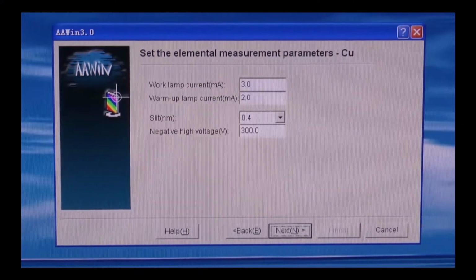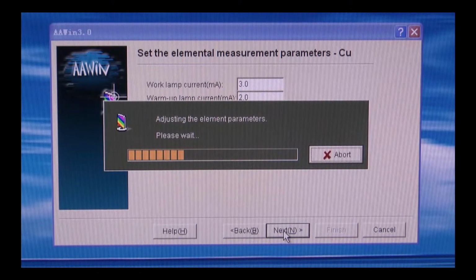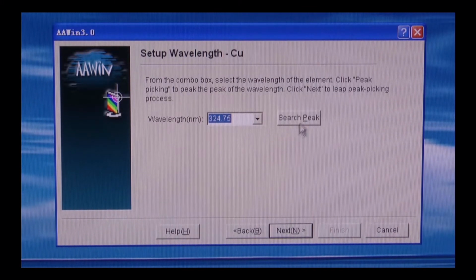This interface is to set parameters of the working lamp. For work lamp current and warm-up lamp current, we normally take the default value. Slit, most of the time we choose 0.4, but for different elements, you can take a reference from our cookbook. Negative high voltage, again, you can keep the default value. Now we press Next. This interface will set up the wavelength. Normally we take the default value and search peak.